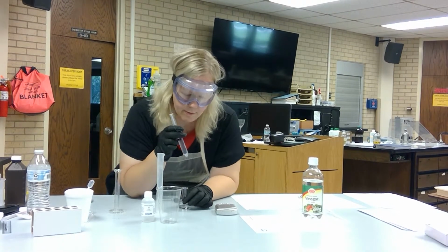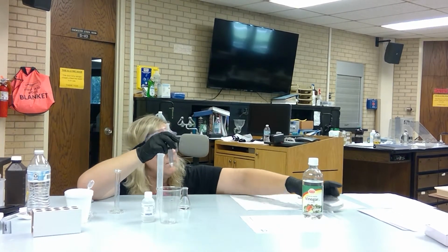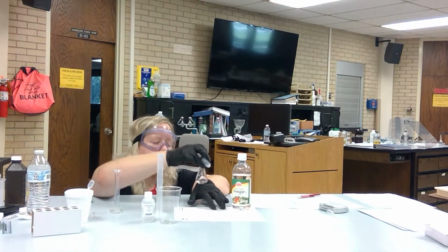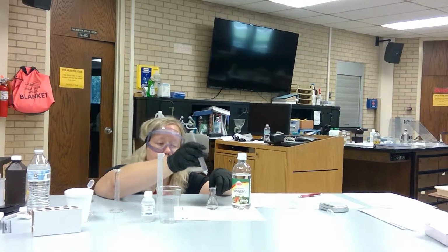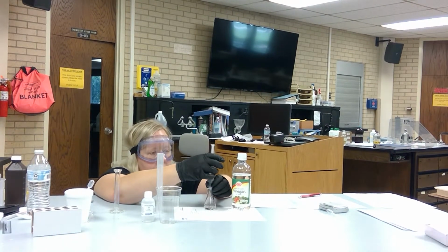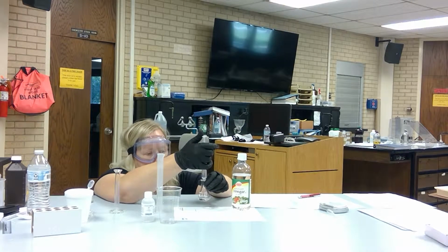All right, so I'm going to try and, you may want to have your volume line pointed to you. And ideally, what you want is a faint pink color. So that's why they suggest putting this under a piece of paper, because if it is a dark pink color, then you've gone a little too far. All right, so I'm going to try and get this to 8.5. And you can already see there's that pink color.